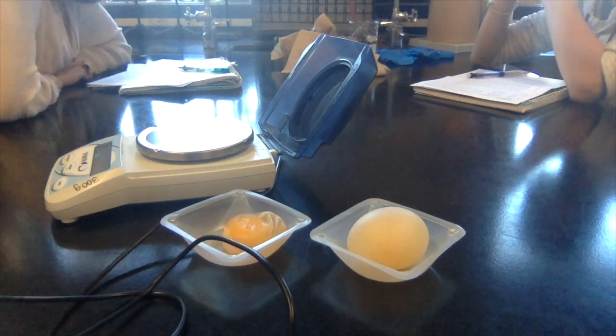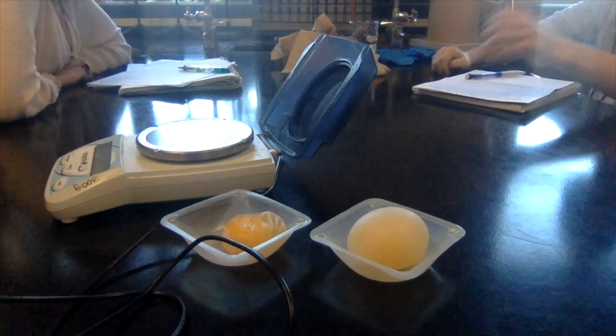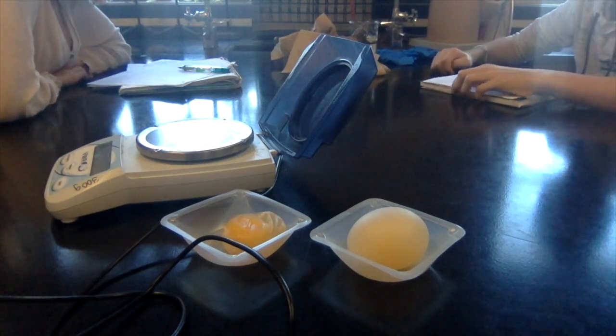That's disturbing. That makes me uncomfortable. 50%? Are you recording? Yeah.